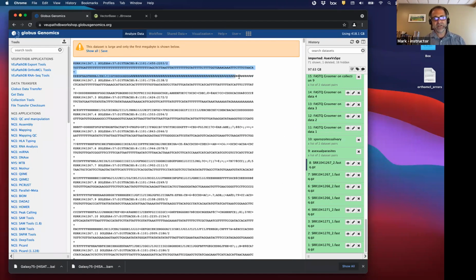This is an entry right here. Every 4 lines is an entry for a read, and the first line contains information about that read. This is actually the machine, and some of these are the position on the slide that's imaged in the machine. So that's information about that read. This is the actual read of nucleotides. Then there's always a plus on this line. And that's followed, as Catherine mentions, by an encoding of quality scores of whether that base was called correctly. So that's what these files look like, and they should look like that.